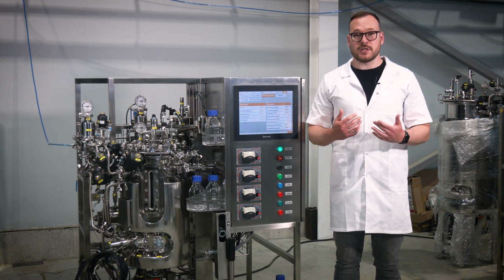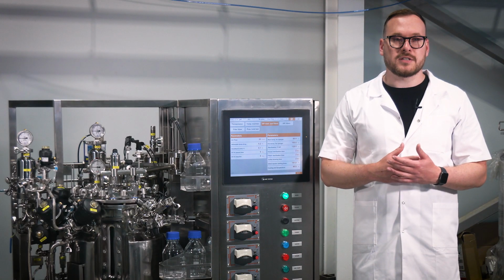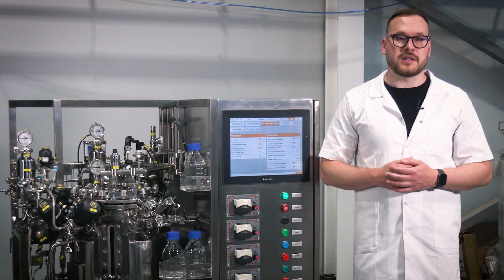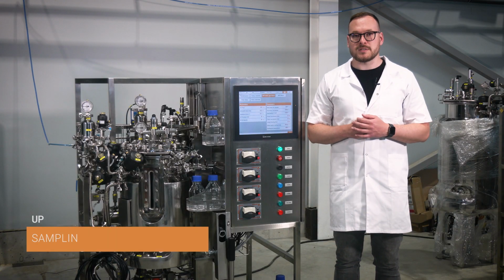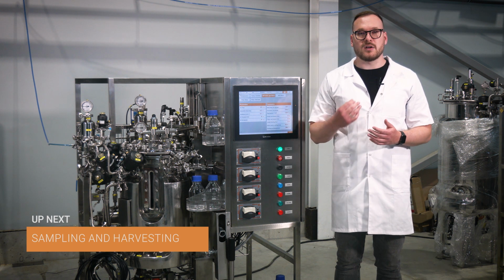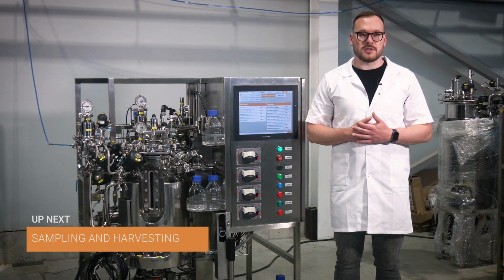Inoculation. For inoculation, you have two methods to choose from. First, inject the microorganism culture into the reaction environment before supplying it to the bioreactor vessel. Second, use a peristaltic pump to transfer the inoculum to the vessel after supplying the reaction environment and sterilizing it. The fermentation process. The fermentation process is an on-off process, which means that the operator must start and end the process manually from the control panel.